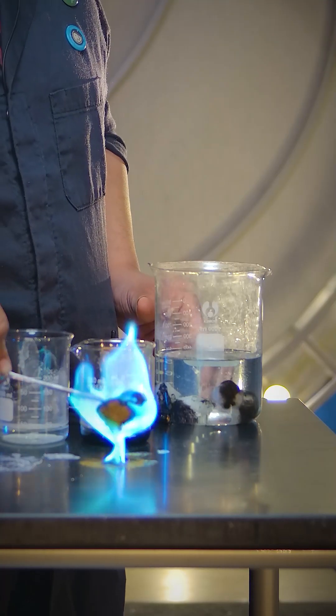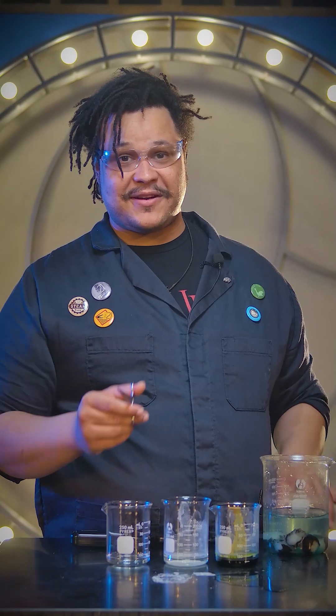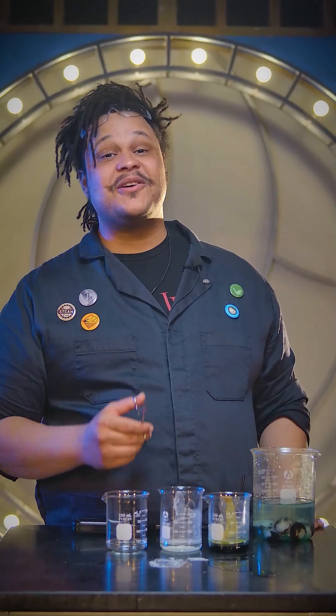Let's go ahead and get these bad boys out. Safely, of course - remember, safety first. And stay tuned for more cool experiments.